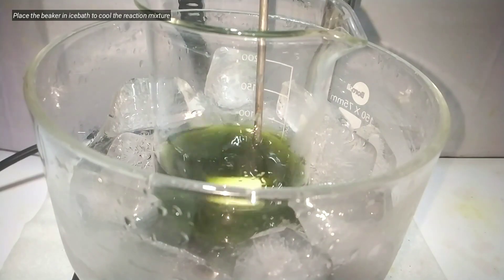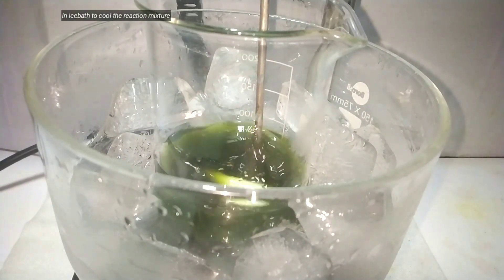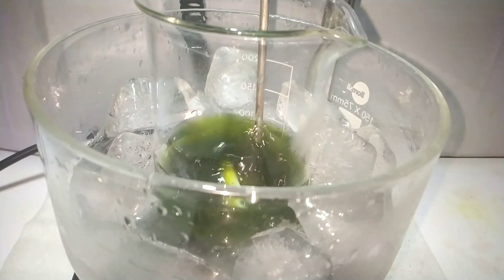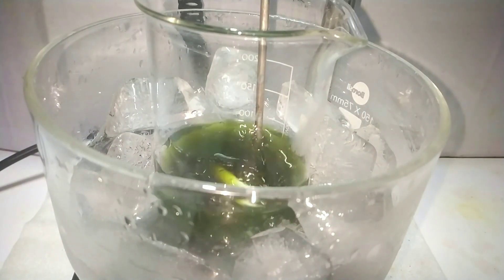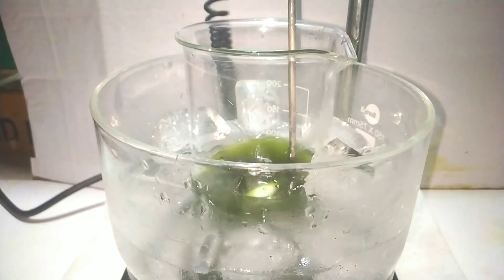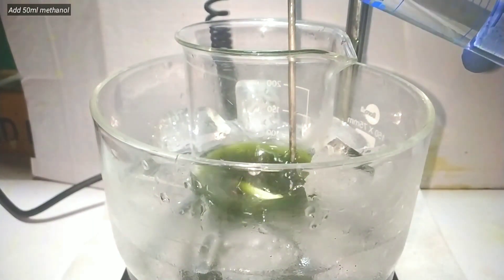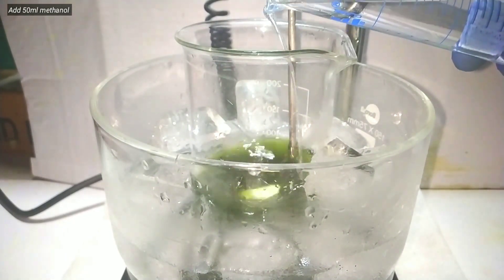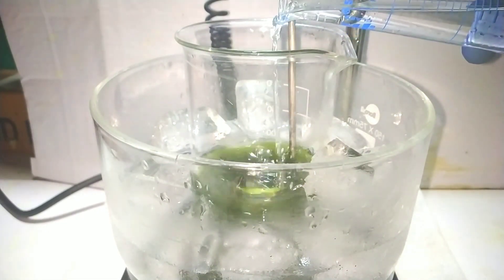After that, we place the beaker in an ice bath to bring down the temperature to below 20 degrees Celsius. This is essential as we are going to use methanol in the next step, which is a pretty volatile alcohol. I have set the temperature to below 5 degrees Celsius. Now I add 50 milliliters of methanol with continued stirring. Addition of methanol would help us precipitate out the sodium carbonate.